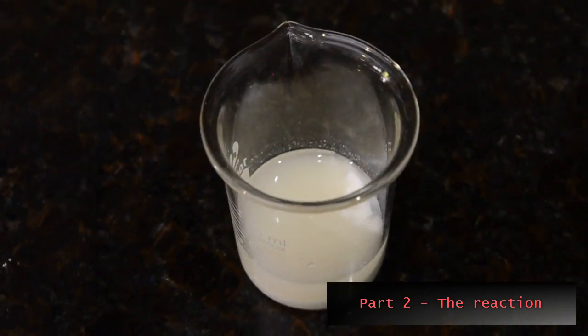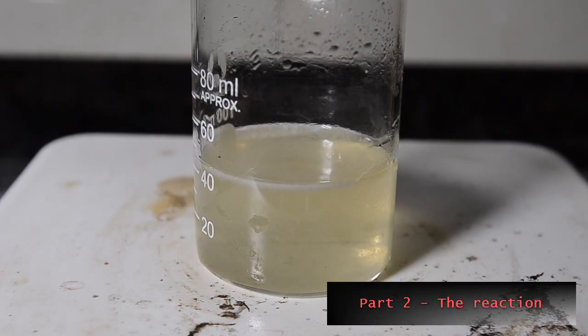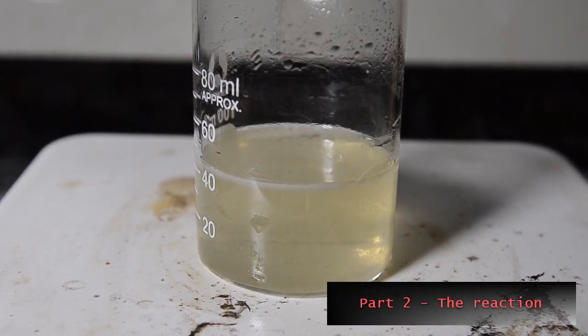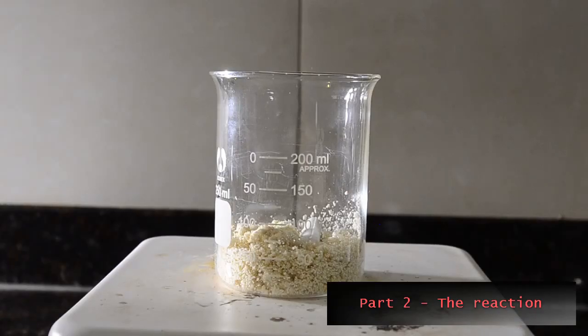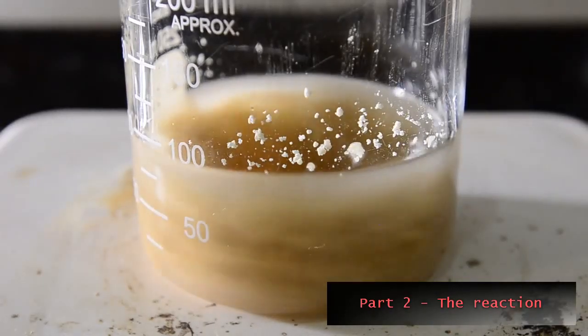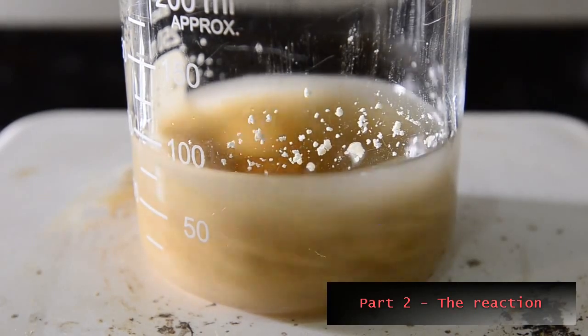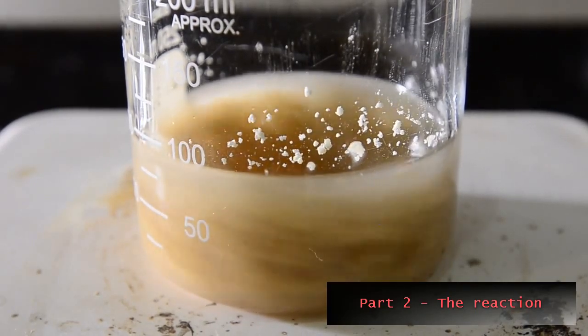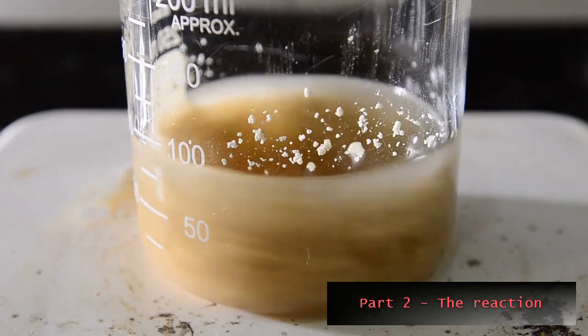Be sure to take care with cyanide salts and solutions. Place the adduct into a 200 milliliter beaker and add a magnetic stir bar. Add the cyanide solution and begin rapid stirring. The adduct will slowly dissolve and form an orange colored mixture.